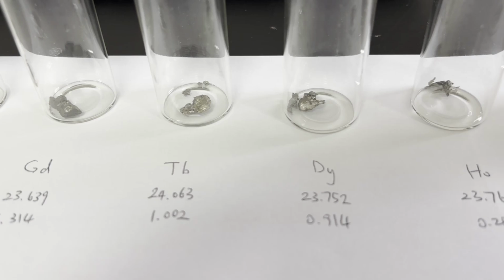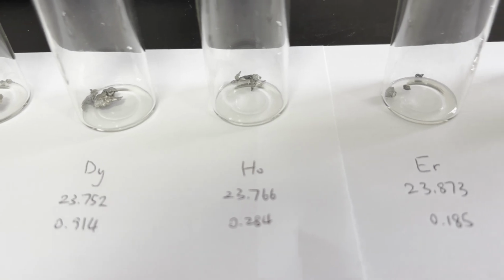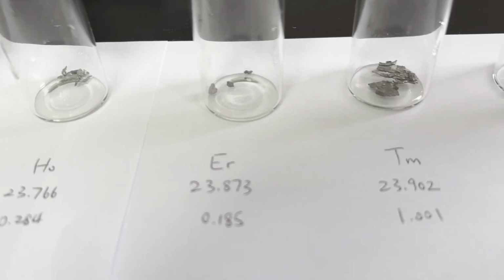Scandium and lutetium are the two most expensive rare earths, and they also don't have the properties I want. The general trend of rare earths is that the elements in the middle have cool optical and chemical properties, while the ones on the sides are boring trivalent metals which give colorless ions.